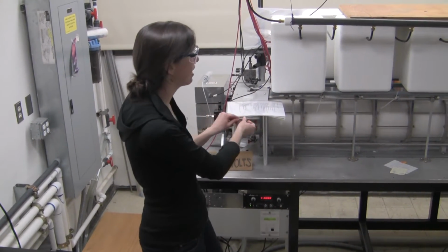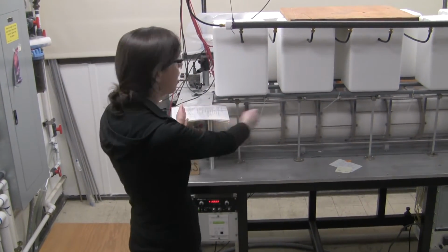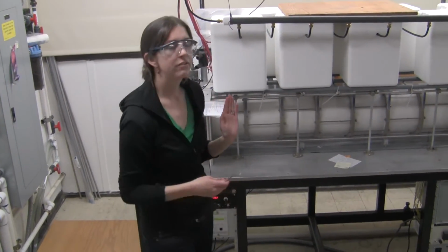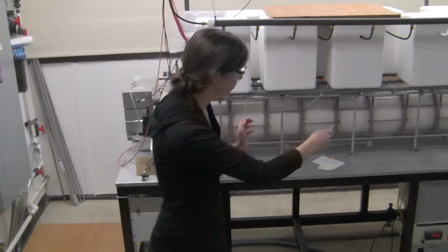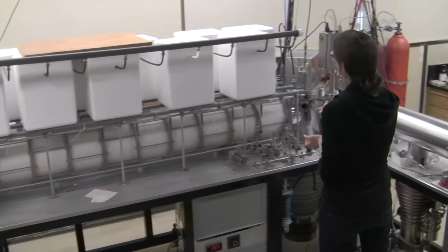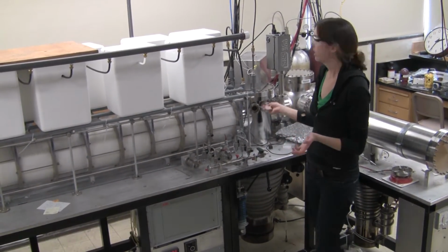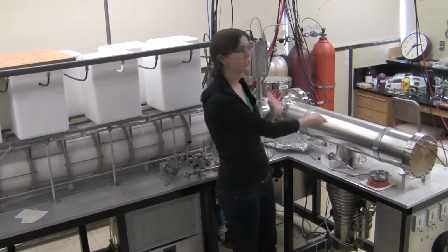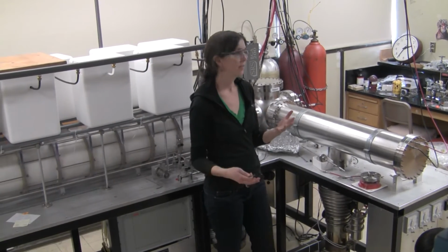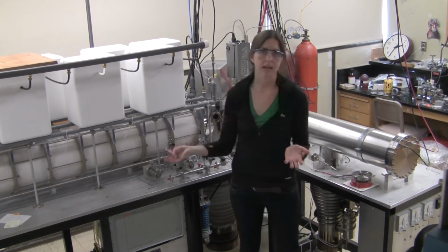They pass through the ion funnel, and then they come into the drift cell. So this long white tube is our drift cell. It's filled with about 13 torr of helium gas, and the ions pass through the drift cell, and after the drift cell they reach the quadrupole mass filter. And here they are mass selected and they can be detected. We also have a time of flight on this instrument here, which we can also use to add additional mass selection in our experiments.